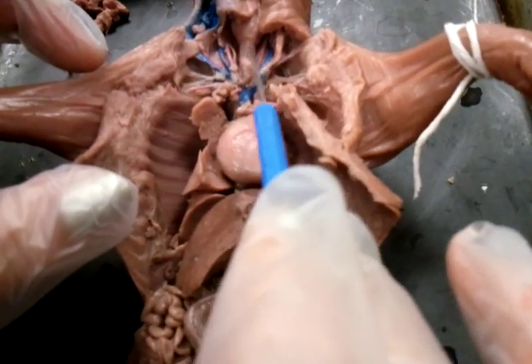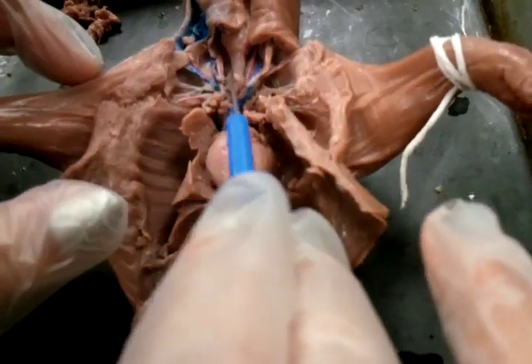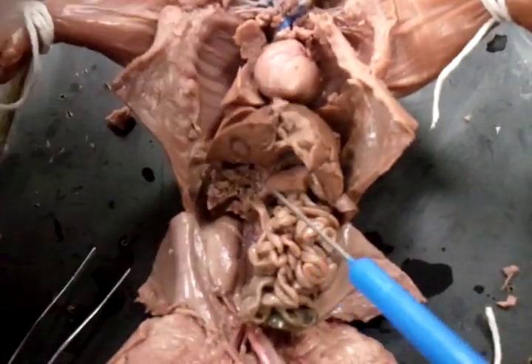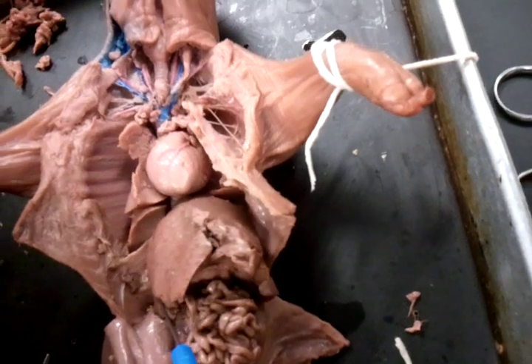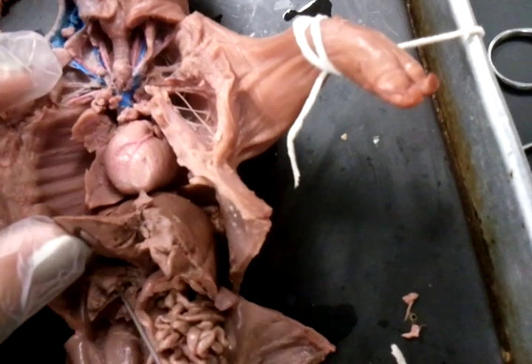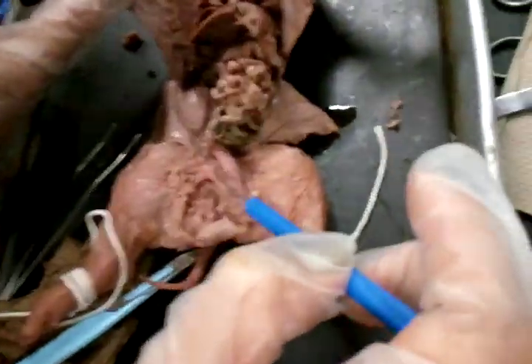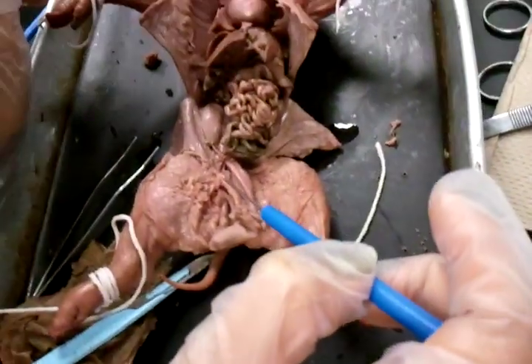Esophagus — I haven't done that, I don't know, I didn't do the throat. But it should be right here. Trachea, yeah. Pancreatic — where's the pancreas? Do you guys know? It should be like here somewhere, by the liver is where it should be. Somewhere over here, under — see, I know this is the gallbladder. Yeah, maybe the pancreas should be close to it. That — oh, that's just dirt. I think that's pretty much it.